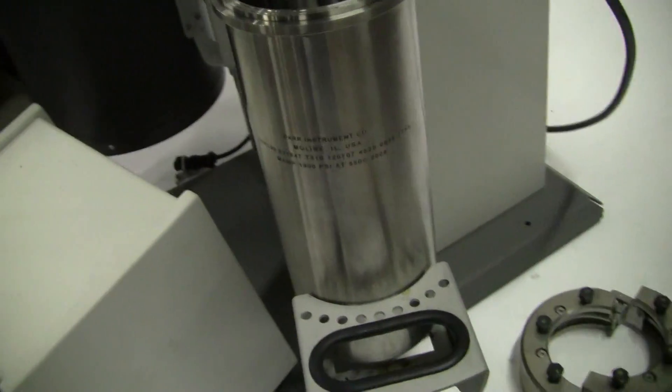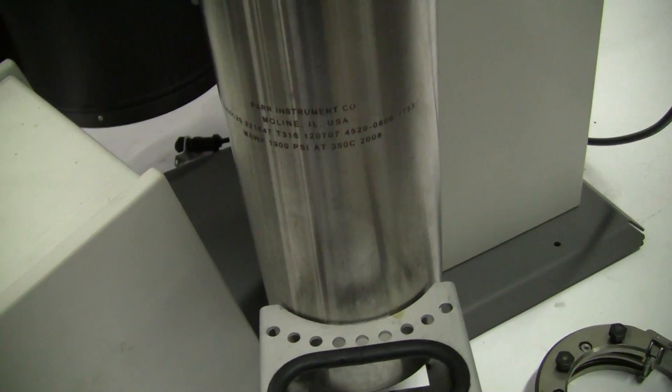Your reactor itself is rated at 1,900 psi at 350 degrees Celsius.